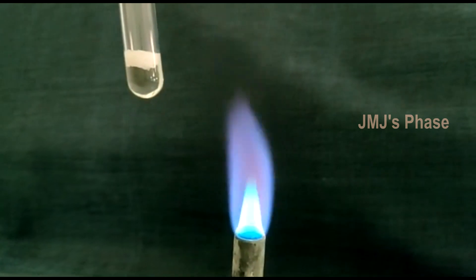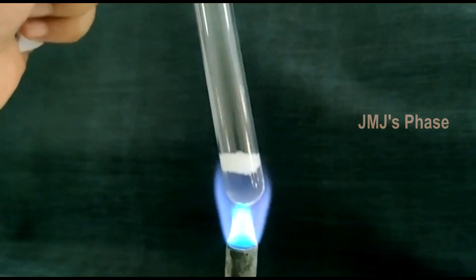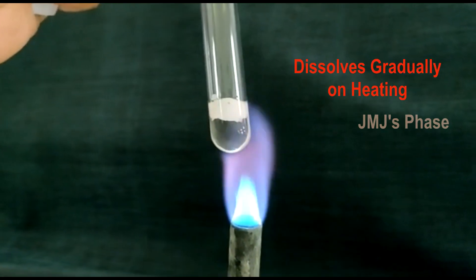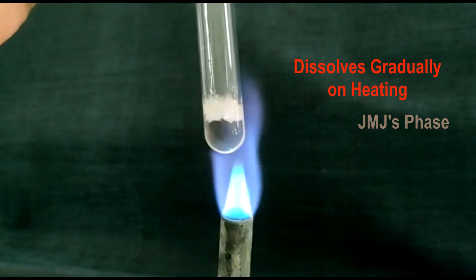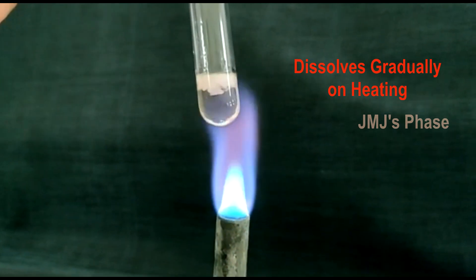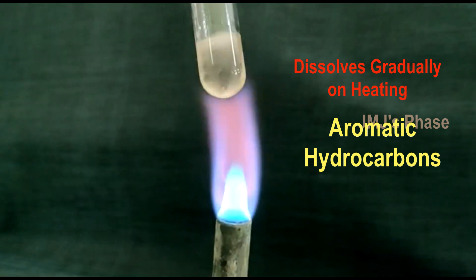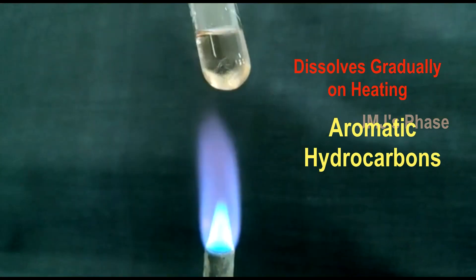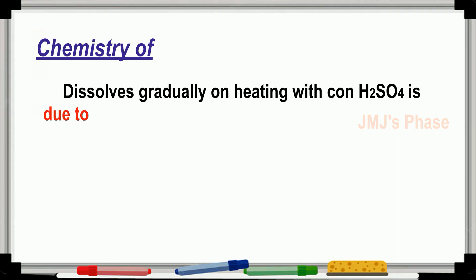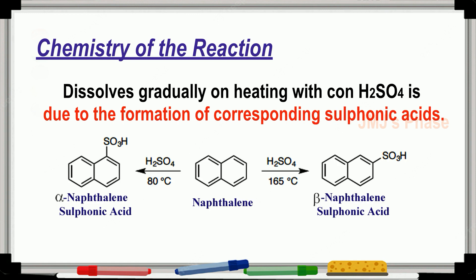Instead, if the organic compound dissolves gradually on heating with concentrated sulfuric acid, it shows the presence of aromatic hydrocarbons. This is due to the formation of corresponding sulfonic acids.